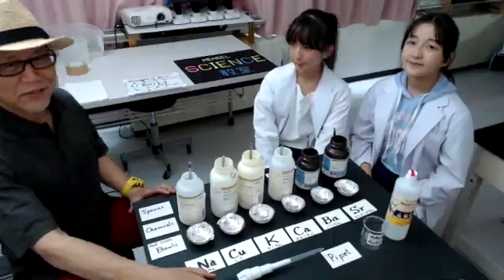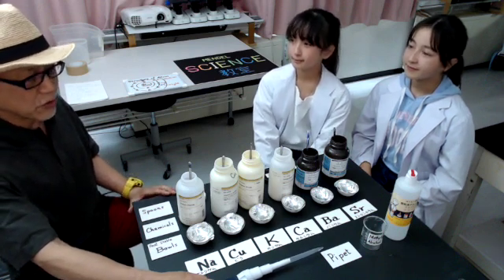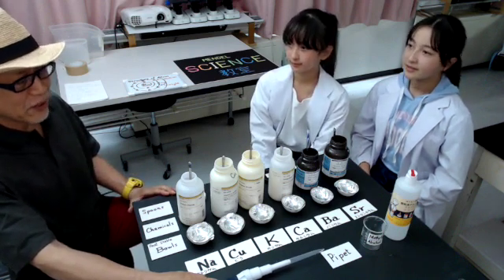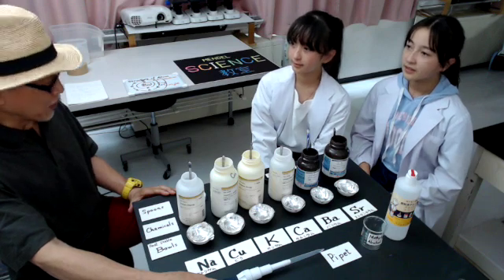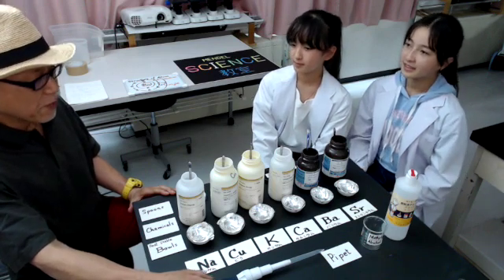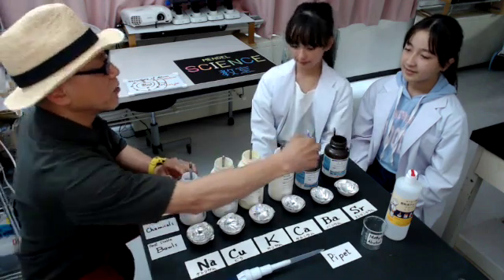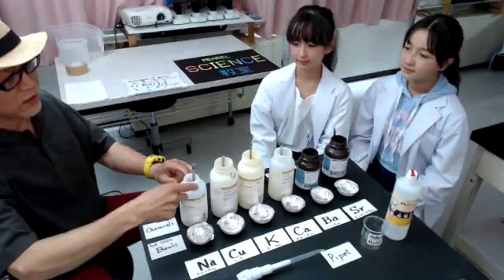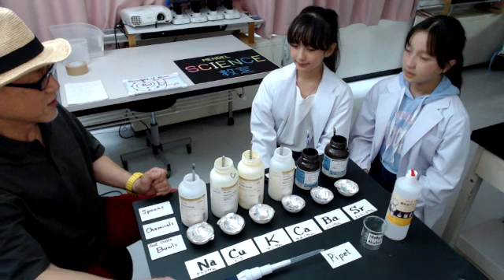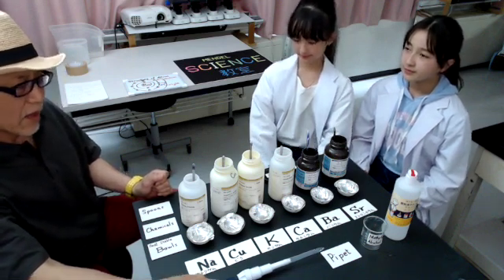Today's topic is flame reaction. Today I will show you the most simplest method for observation of flame reaction. I prepared six different types of chemicals that contain different types of metals or elements.